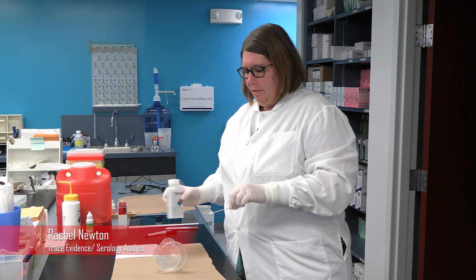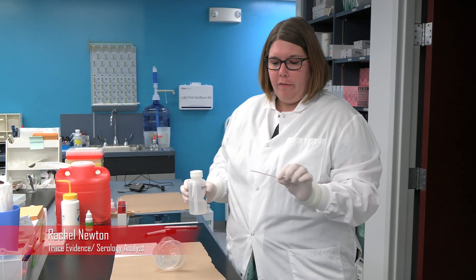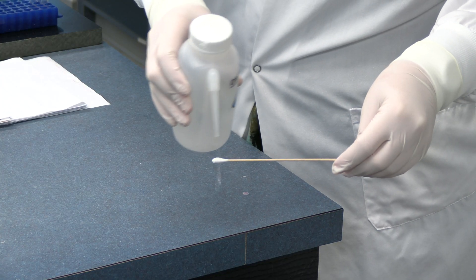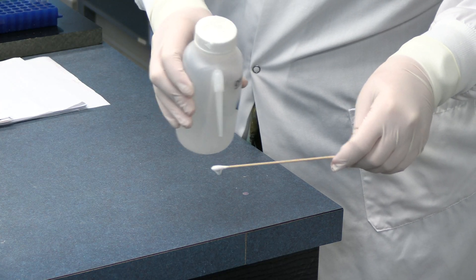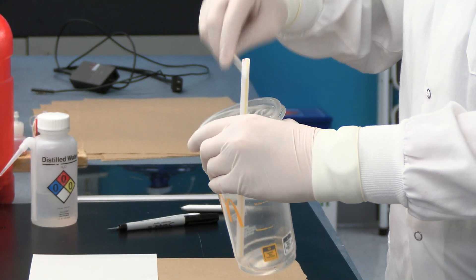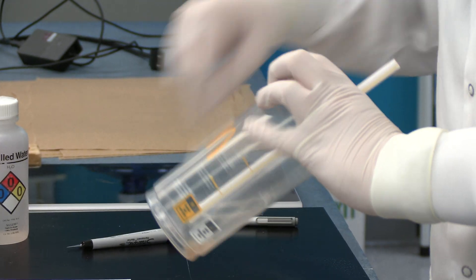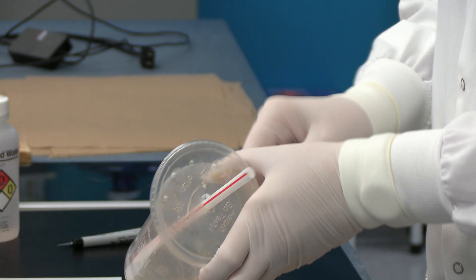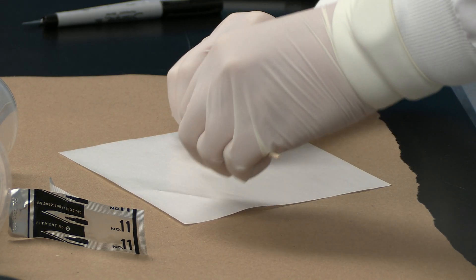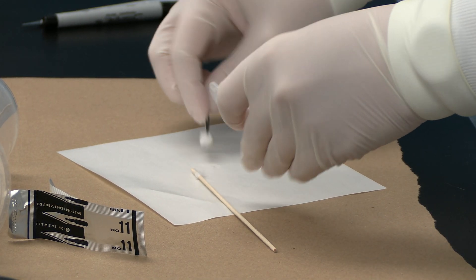Typically these are the types of items we'll get in for touch DNA. First, we're going to take a swab and just moisten it a little bit, then swab really well where their mouth would have been on it, where they would have touched it and grabbed it. I'll then take this swab, cut it, and send it on for DNA.